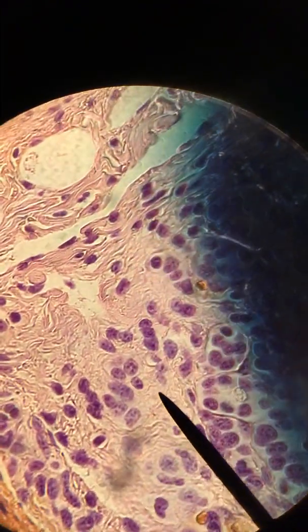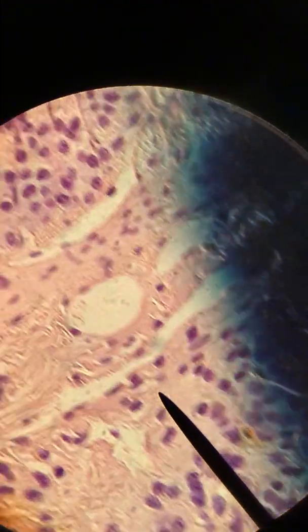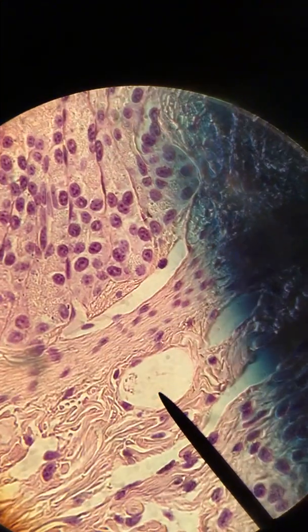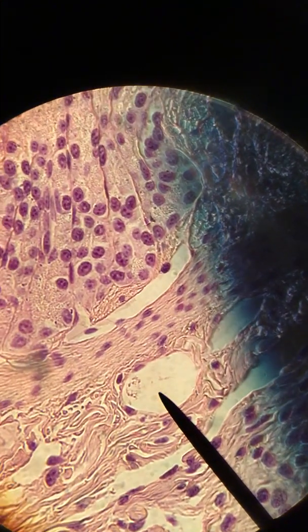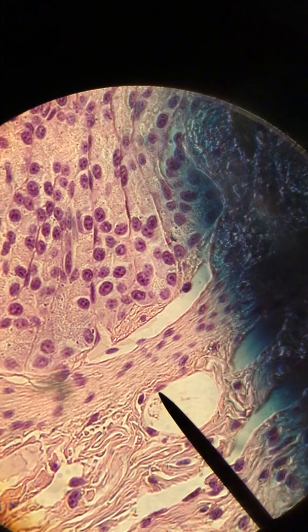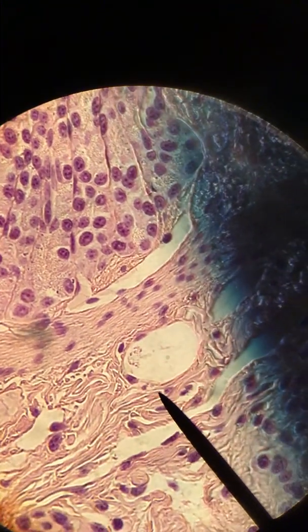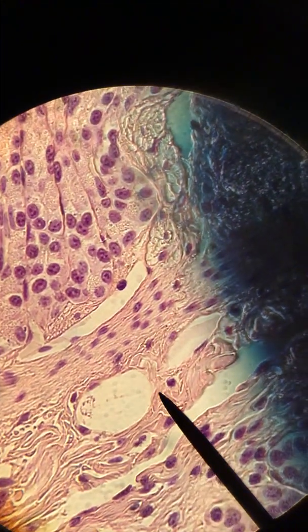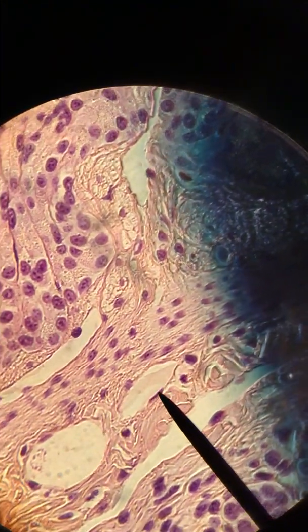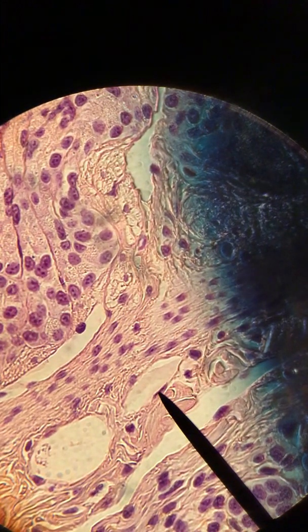We're also asked to look for simple squamous epithelium, which I think I see over here. This could be a blood vessel right here — you can see there's a little squashed-up nucleus right here, and another right here. These line blood vessels, and these would be simple squamous epithelial cells.